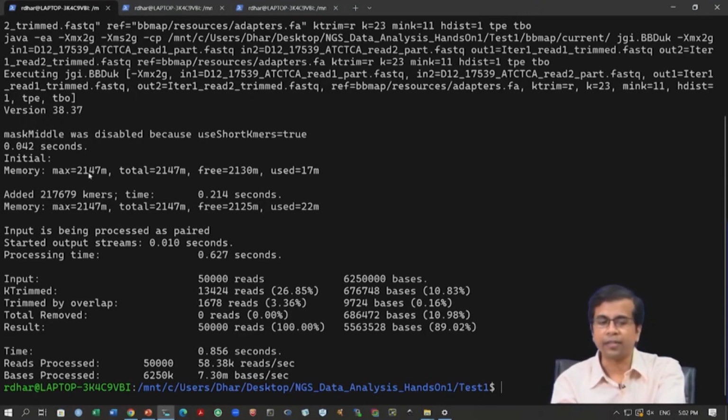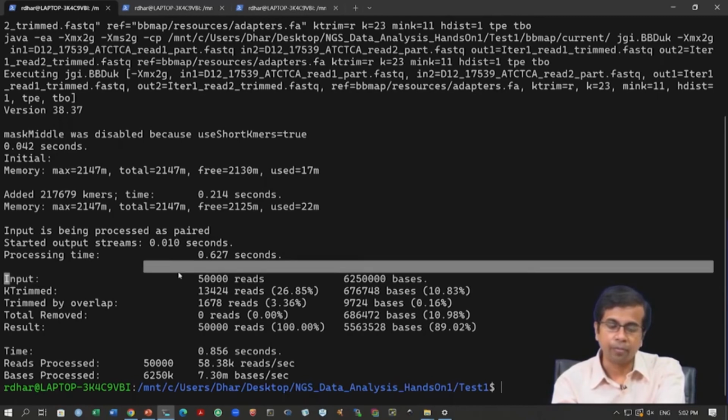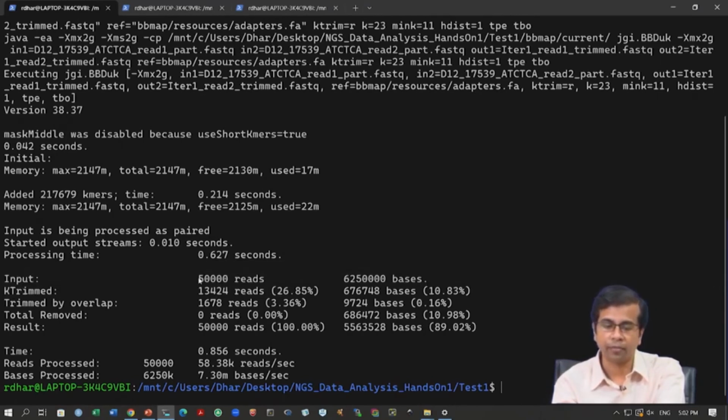It will give you some statistics regarding how much memory it utilized in this system, and then it will give you some statistics about the reads that it has processed. Here it gives you some information about the input. It has about 50,000 reads in total. It processed 25,000 plus 25,000 in 2 files, and it processed about 6.25 million bases. So in this read data you have 6.25 million bases. It has trimmed certain reads, about 13,000 reads and about 676,000 bases, roughly, which is about 10-11% of the data.